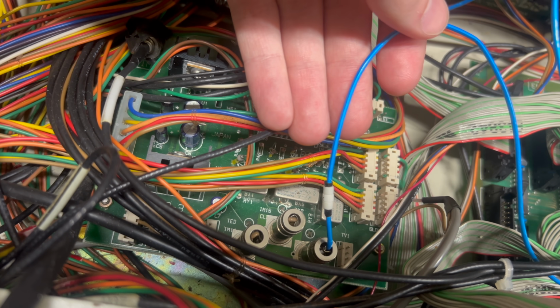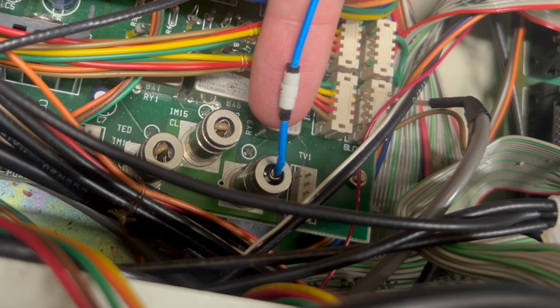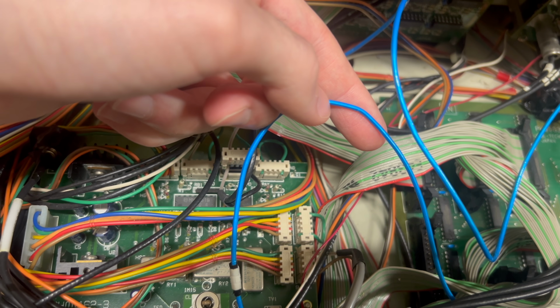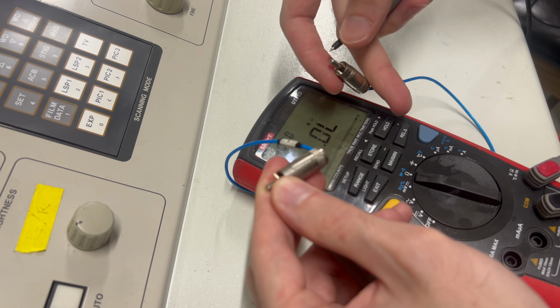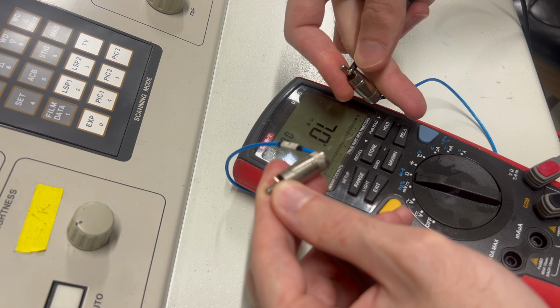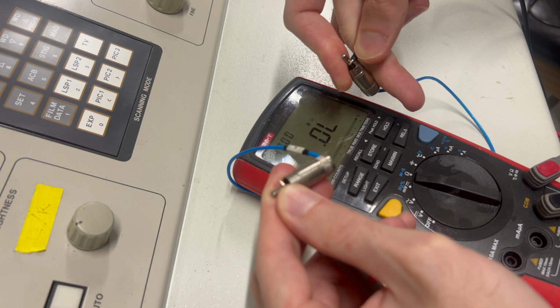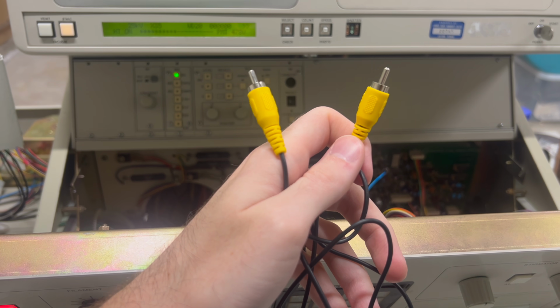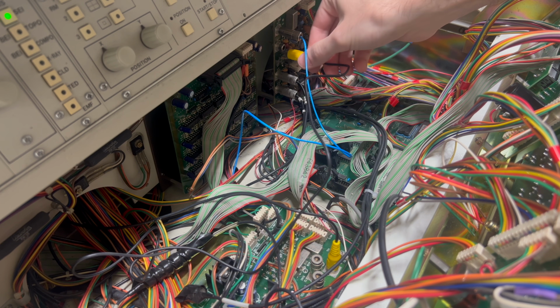Check out this RCA cable. Doesn't that look a bit damaged? I bet you that in the process of modifying this scope, the cable ended up getting into a bad orientation and got kinked when this door hinged closed. Yep, that is one broken cable. Fortunately, I have a replacement. Looks like my cable hoarding comes in handy for once. I'm not sure when was the last time I used one of these to carry an actual video signal.